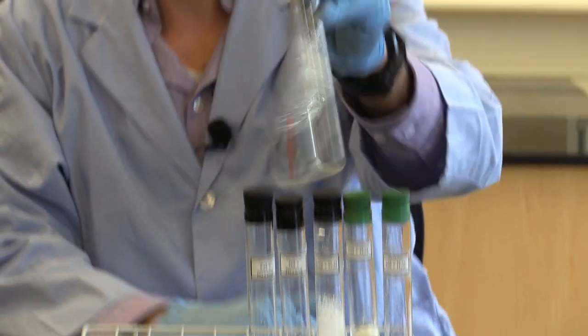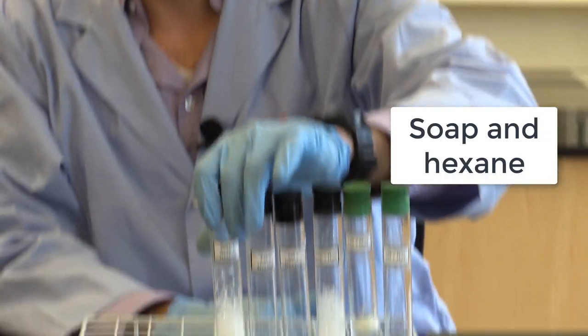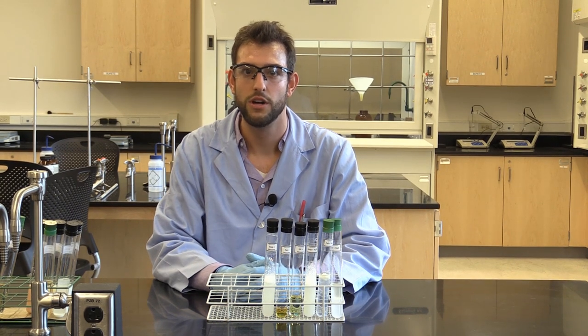And then the soap and hexane is just as cloudy because the soap is partially polar and nonpolar. We are proving the like dissolves like rule. Now, with soap mixed in with hexane, we see that it is cloudy. More evidence of the dual polarity of soap.